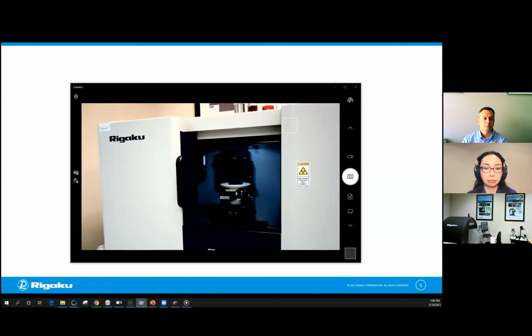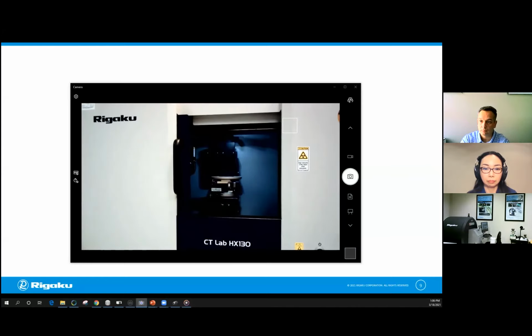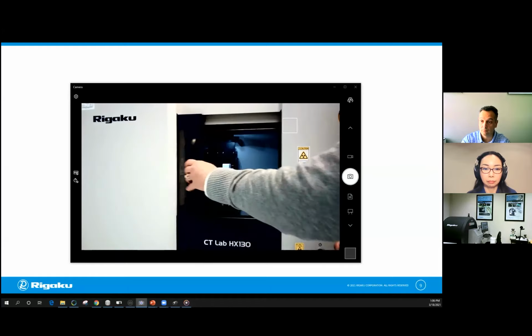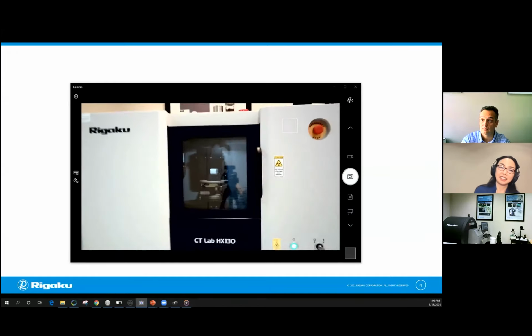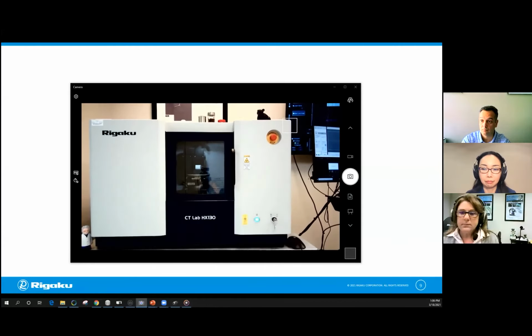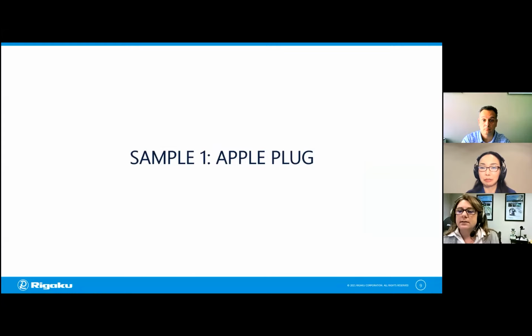And then next, I'm just going to place our Apple plug on the sample stage, the center, right? Before we measure this particular sample, we want to make sure it's centered in the X-ray field of view. So we call it an Apple plug, but I'm not sure if that's a technical name for this. Right. I can verify that that one was purchased from the Apple store. So. Looks like it. Yeah, I had another one, and it's less complicated inside. So. Oh, it's different. It is different.